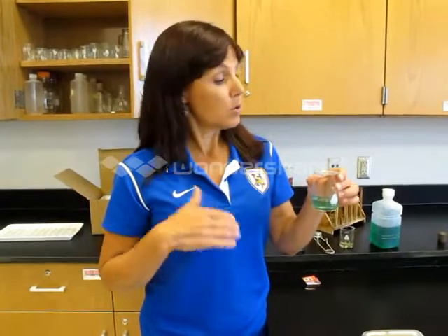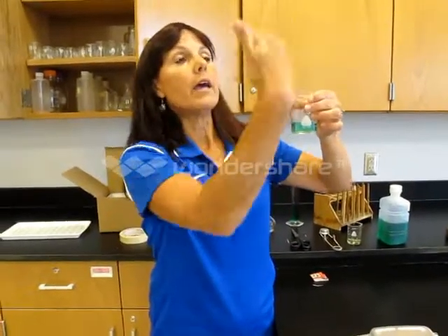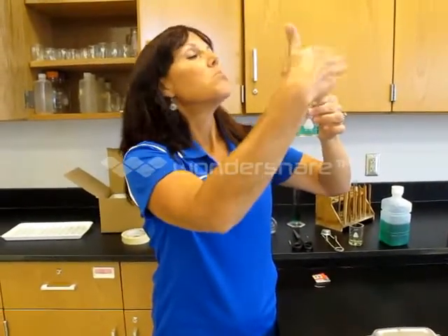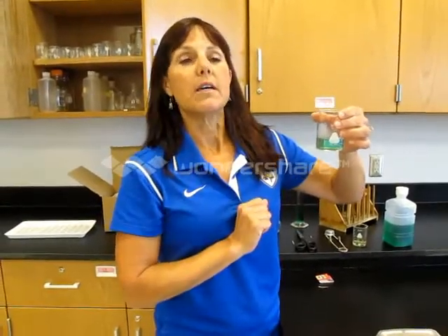Sometimes you are asked to make observations about the smell of something — the scent or odor. You need to be very careful not to take in too much, and a good way to prevent that is to use the wafting method. Keep the container a good distance away, fan your hand toward your nose, and take a little sniff, so you only get a few particles instead of a big breath of ammonia or chlorine that might be in the solution.